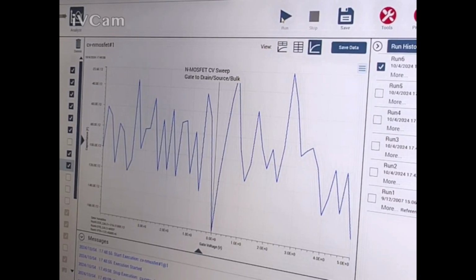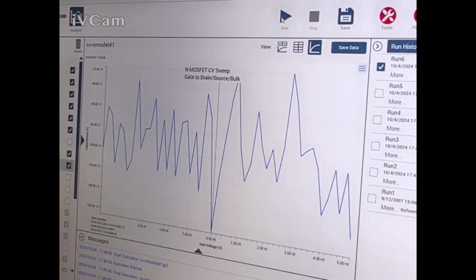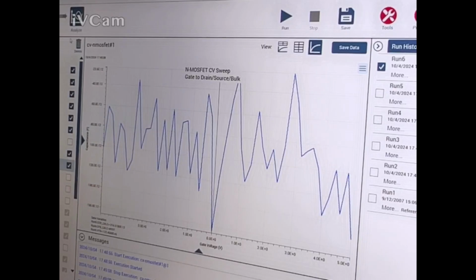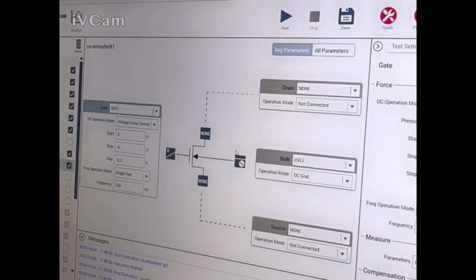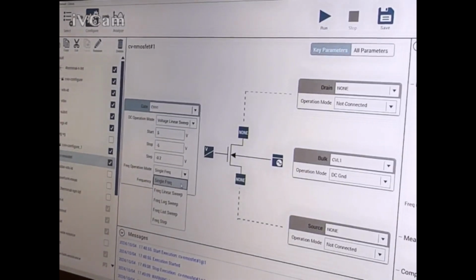CV high is on the gate. Like low frequency, high frequency, did you set that frequency? Yes, I did. You said there wouldn't be a need in the configure to set those up, like they were on none. You said it's okay, defaulted. Okay. The frequency is single frequency. You can do a sweep if you want, as well. I was saying for the drain and the source, you don't have to set. I know you shorted it on there.